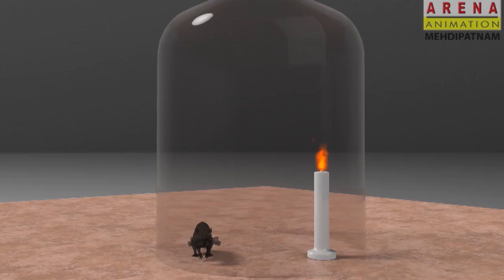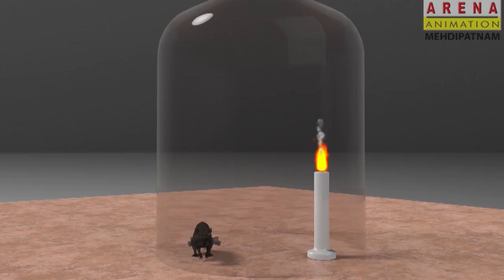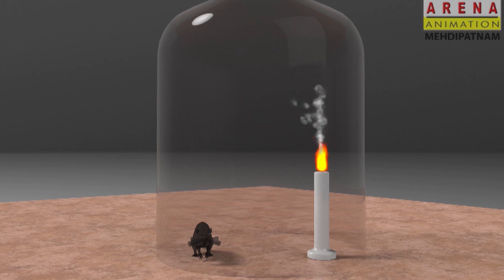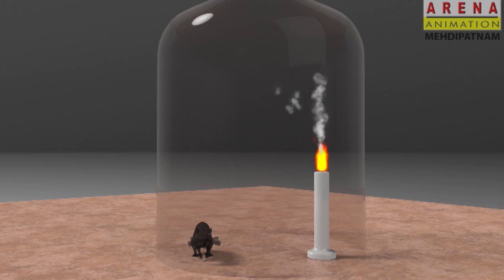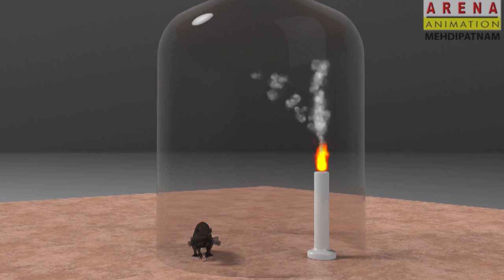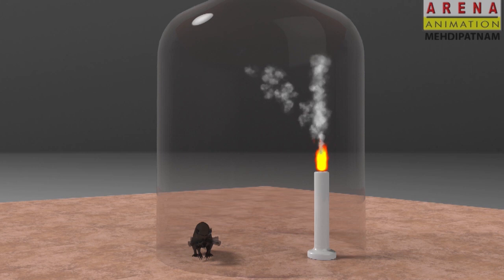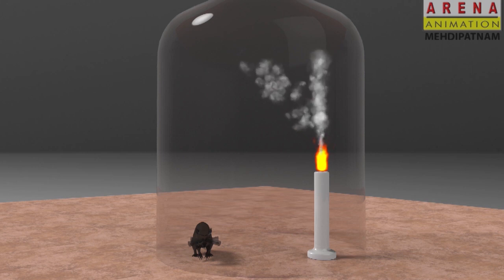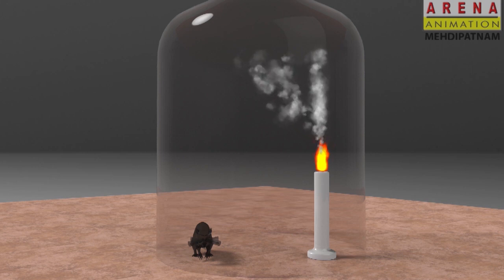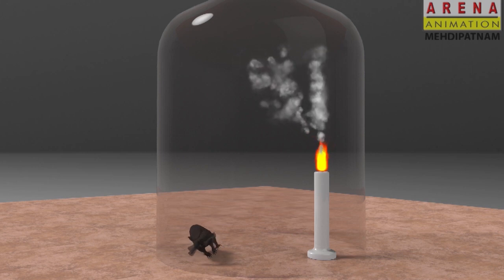Experiment 3. Light up the candle. Place a rat with the burning candle. Now keep the bell jar above both of them as shown in the video. The rat died within very few seconds.